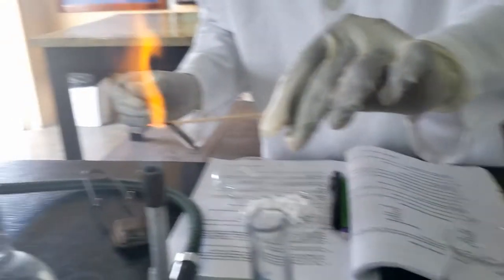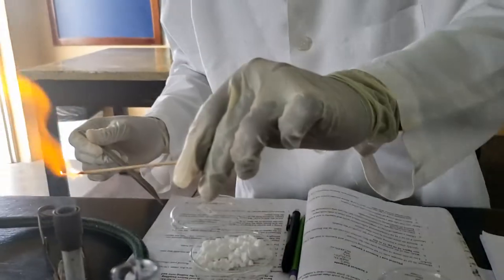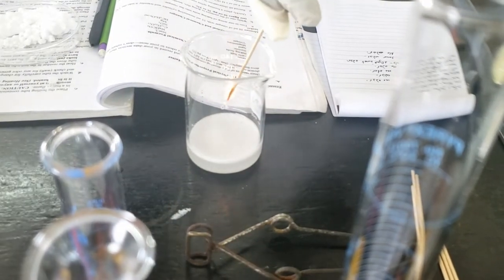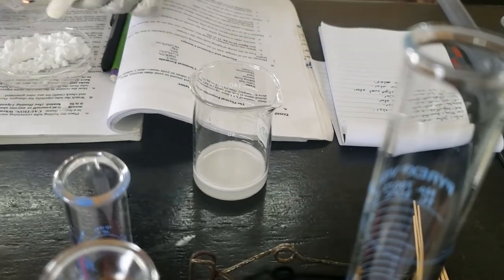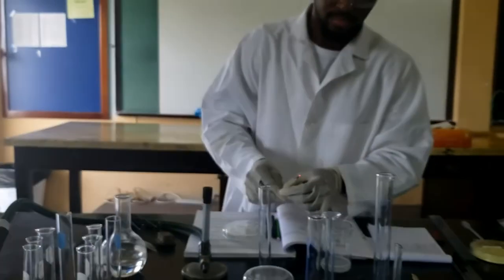We try again before it stops bubbling. We can add another scoop. Notice the flame — it goes out. That's experiment number one, quick and easy.